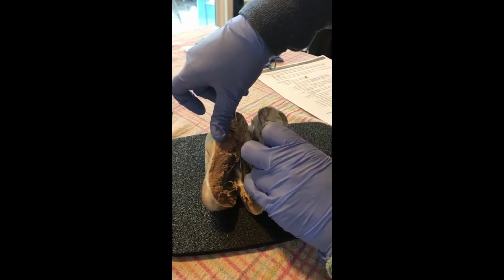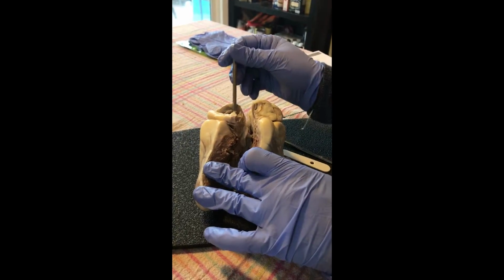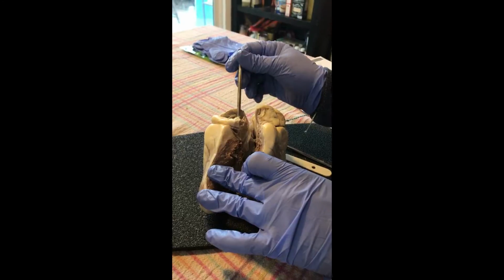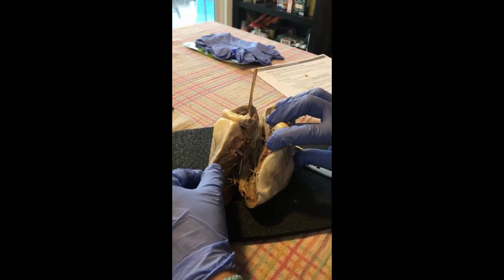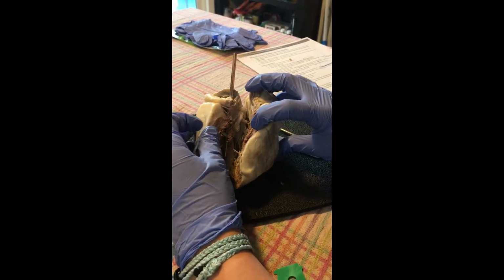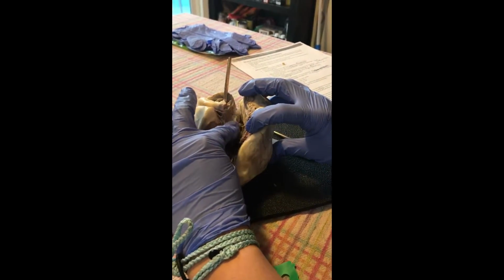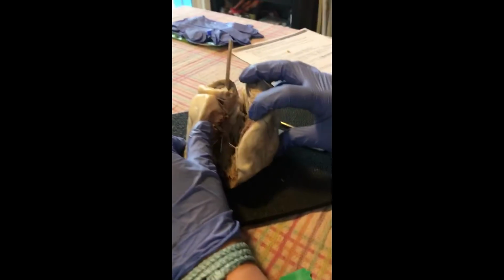And the probe comes through the aorta and the brachiocephalic artery to the left ventricle. We have the mitral, or the left AV valves, or atrioventricular valves, that connect the atrium and the ventricle.